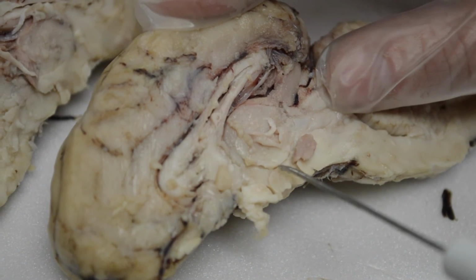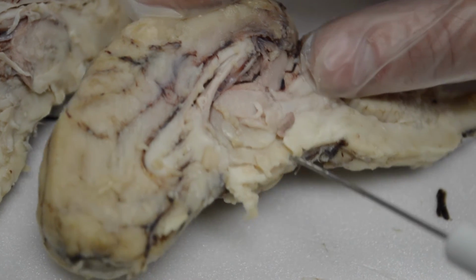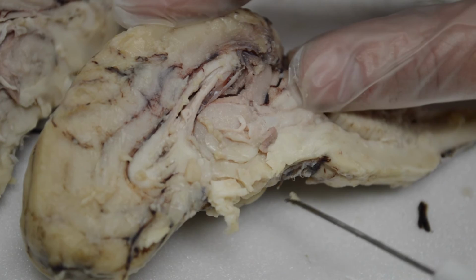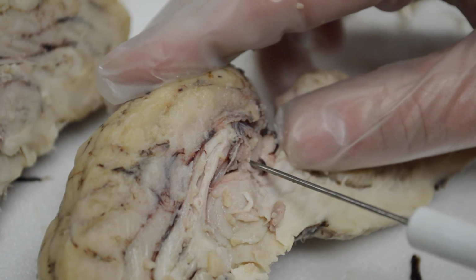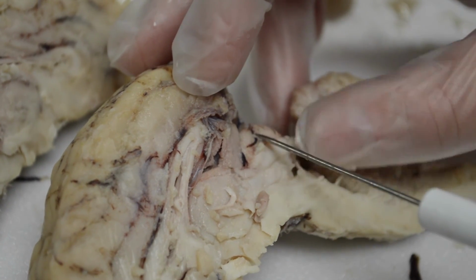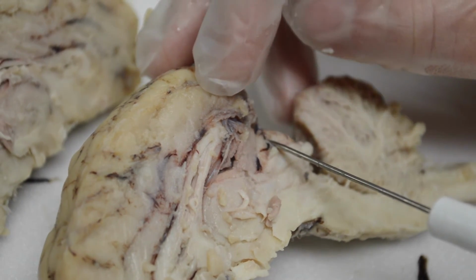Below the thalamus would be the hypothalamus here, and then the pituitary infundibulum, which we only have that little piece of, but the infundibulum would hang, and then the pituitary would be down here. On top of the thalamus is the epithalamus that we peeked at from behind. This is the superior colliculi, the top of the corpora quadrigemina.